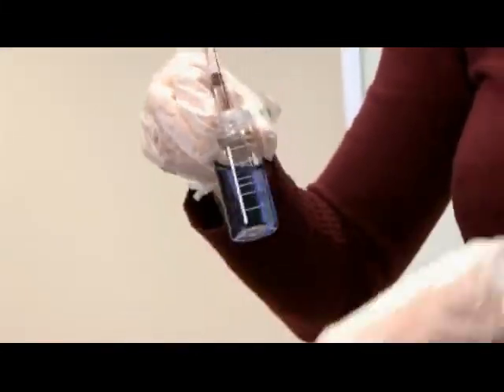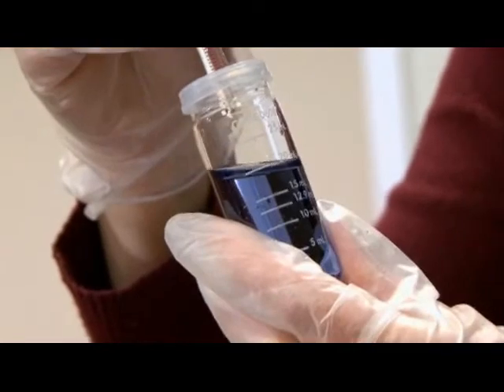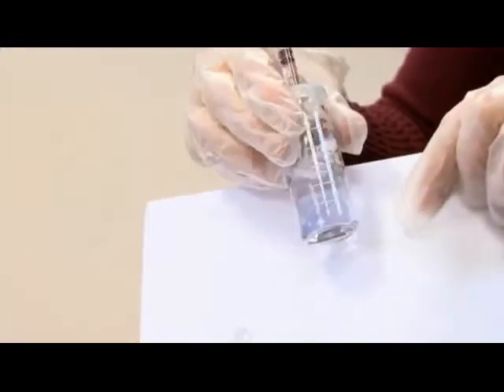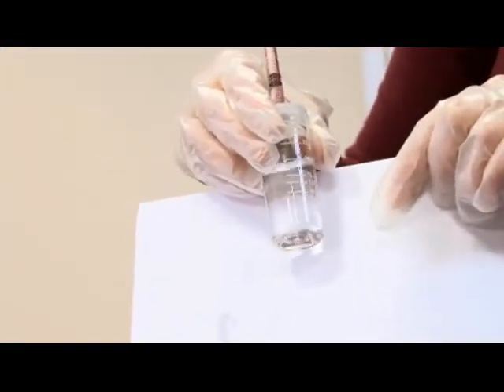I'm going to compare against the white paper. It's still slightly purple, so I'm going to add one more drop, swirl, and now I have a clear solution.